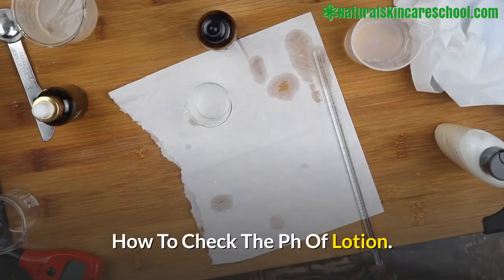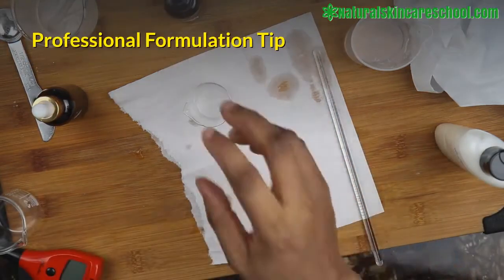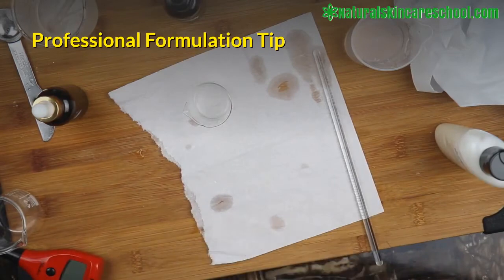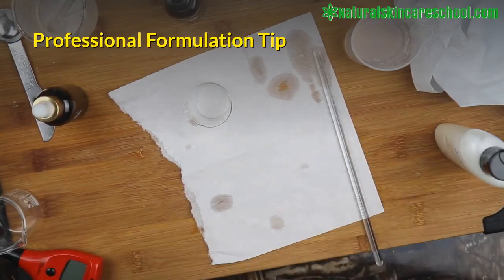In this short video, I want to show you quickly how to check the pH of your lotion. The other time I checked the pH of a serum, but this one I'm going to check the pH of lotion.